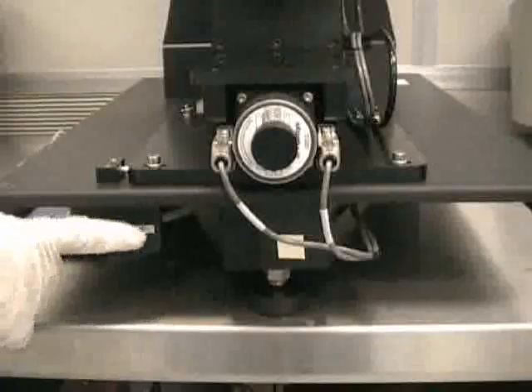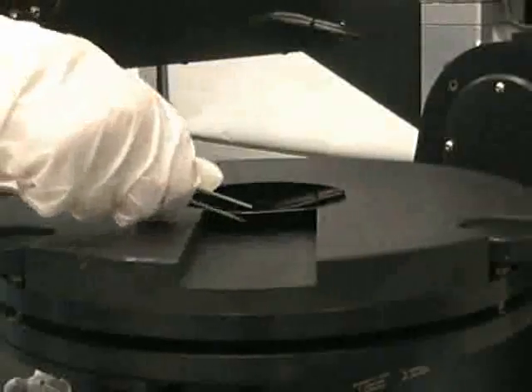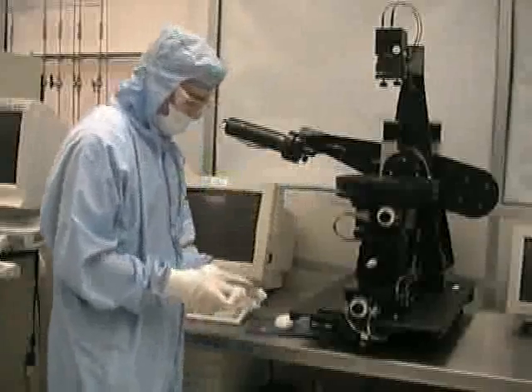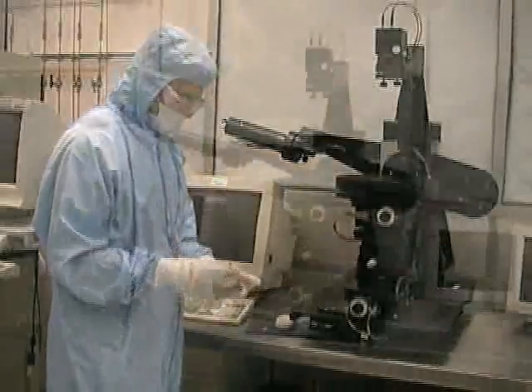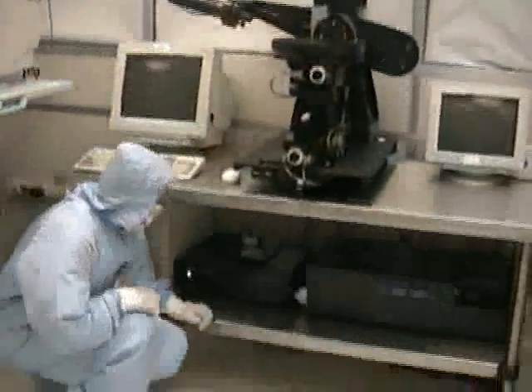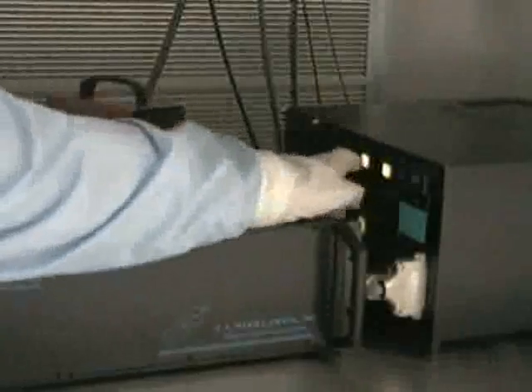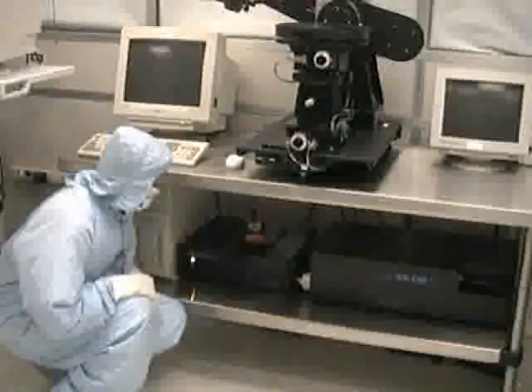Once the scan is finished, toggle the vacuum to vent and remove your sample from the stage. If this is the last sample you will scan, turn off the ellipsometer lamp by pressing the lamp power button on the monochromator system. The lamp ignition button will turn off automatically. Switch the vacuum pump to off.